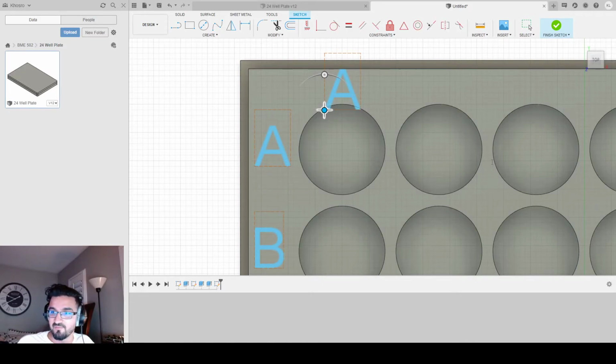We're going to double click it, change the text to 1, and we're going to change the height to 7. And then we're going to grab and snap it right at the line here. So now it's directly at the center of my first well. You're just going to click OK, copy, rinse and repeat, move over by 18. You're at the center of the next one. OK, double click, and change that to 2.